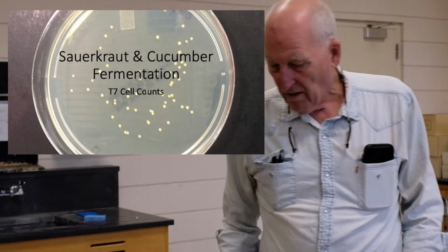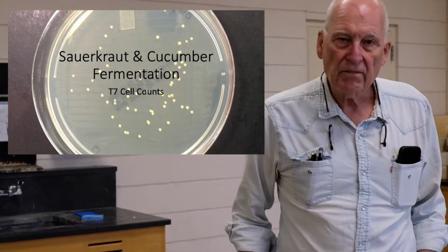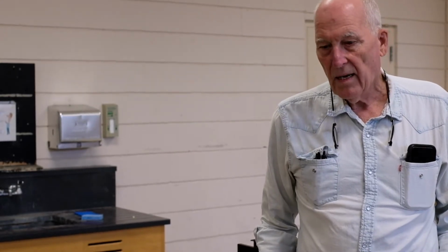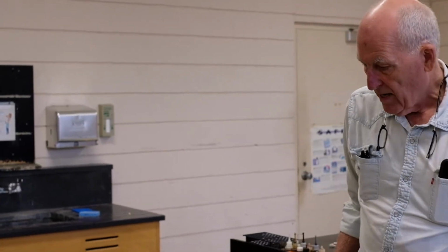Okay, we are into roughly 7 days of fermentation for both our sauerkraut system and our cucumbers. And what we've been doing is enumerating. With 2 days we did a plate count, and in 5 days we did a plate count. And what we're hoping to do is to follow the succession of the lactic acid bacteria as the system processes.